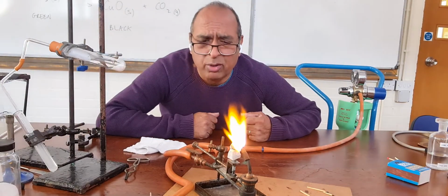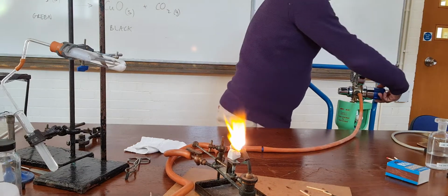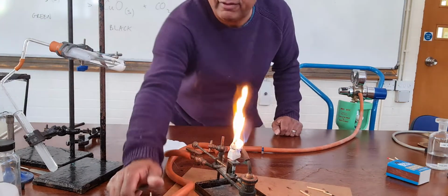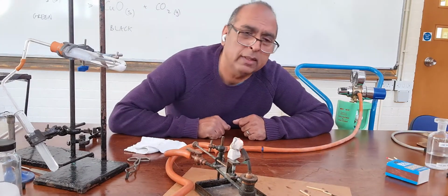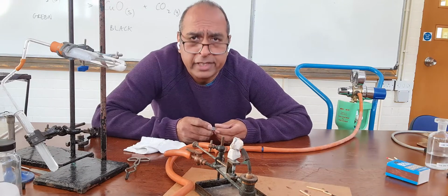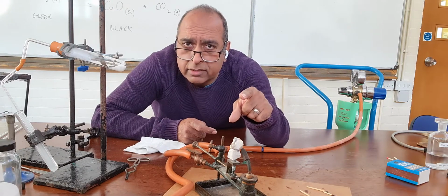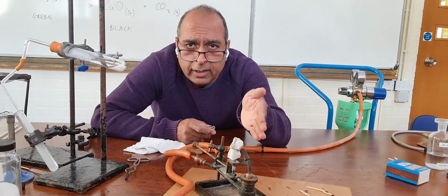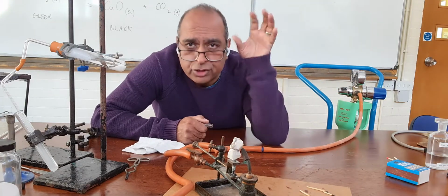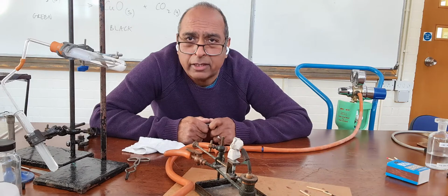I don't like it because it's loud, so I'm going to turn it off. I hope you can see the brightness. So that's the oxygen turned off, and that's the gas turned off. So what I was trying to say with all that noise going on was that in theatres in the old days, they used to burn marble pieces. And when they heated them strongly, they gave off light. And that light was used in theatres as the limelight for shining on actors that were on stage. It's where the phrase "in the limelight" comes from.